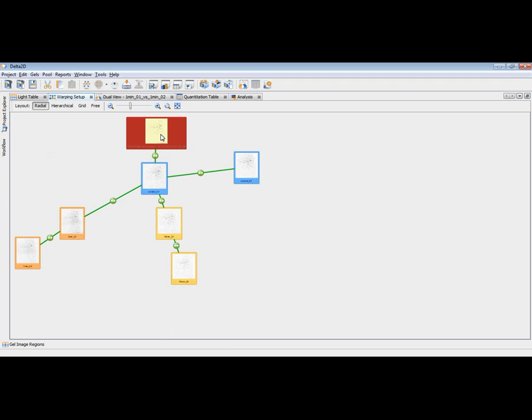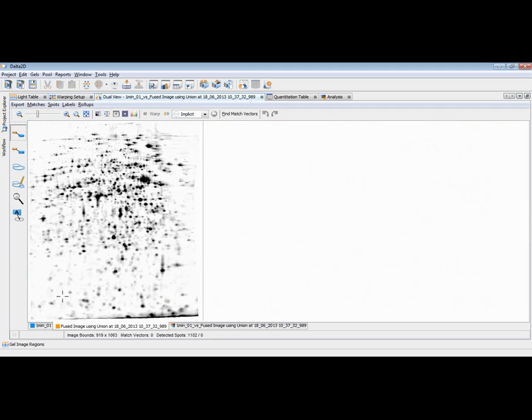Let me first open it so that you have an impression of how the fused image looks. As you can see here, it looks like a real gel image. You really can identify the spots that you typically know from other gels. You know which spot contains which proteins. It's your experience with your organism, and the fused image keeps all this nice impression of your gels. It's a really nice looking gel image where background has been subtracted.